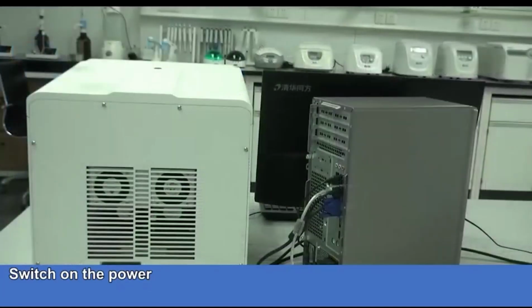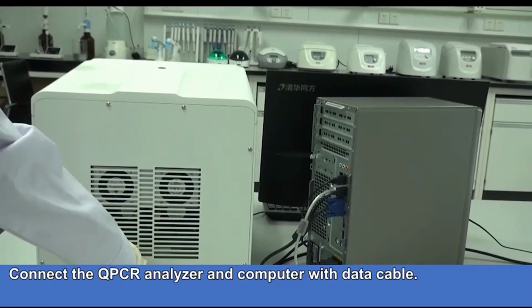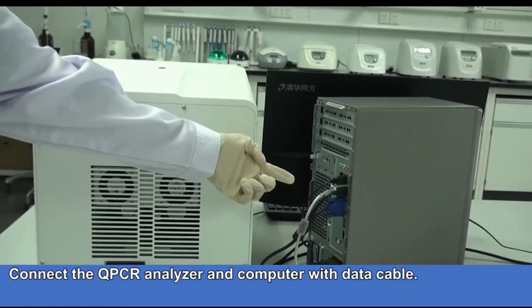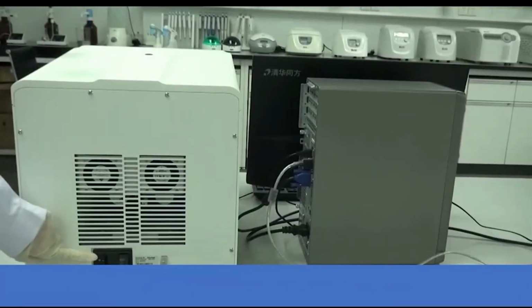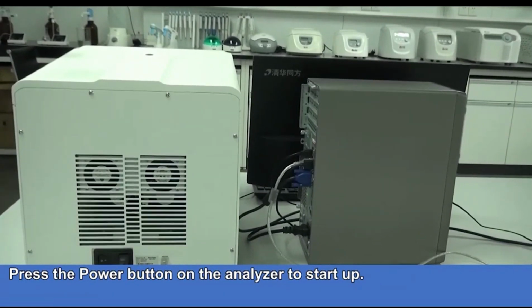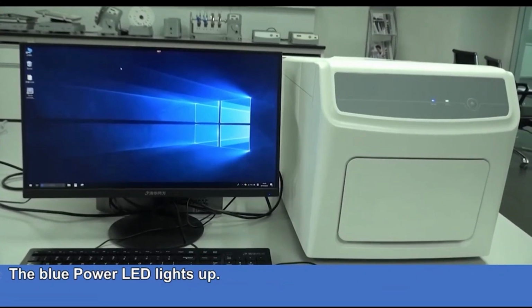Switch on the power. Connect the analyzer and computer with data cable. Press the power button on the analyzer to start up. The blue power LED lights up.